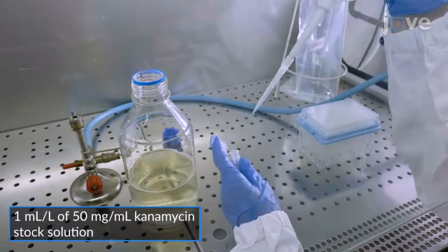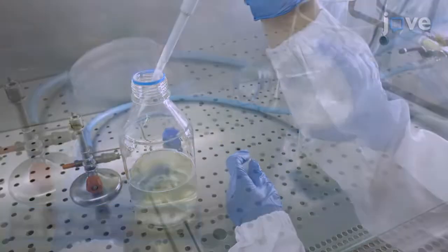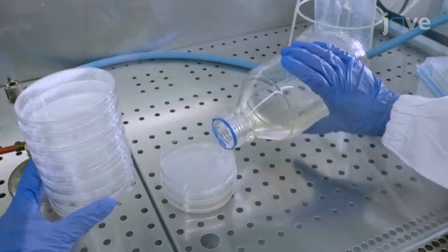To prepare a selective medium, add kanamycin to the medium and pour it into petri dishes as demonstrated earlier.